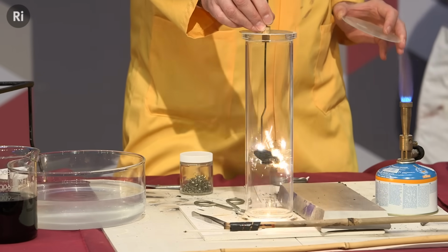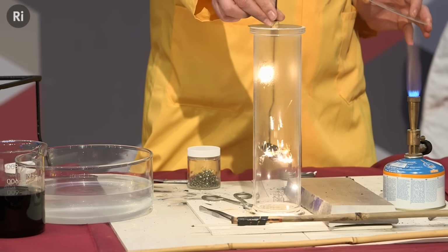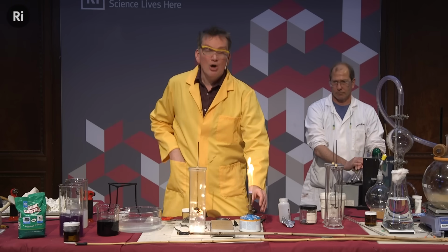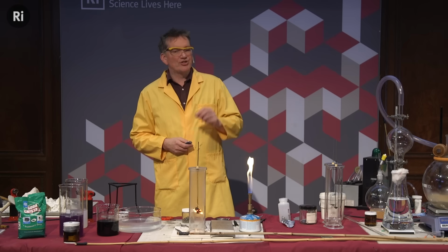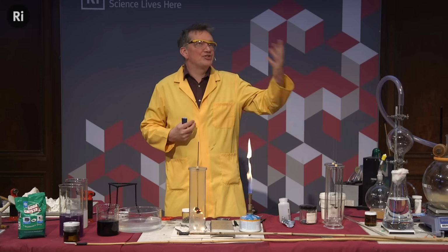we get a much more vigorous reaction taking place here. Okay, so it goes very easily. This is combining with plenty of oxygen. We're going to form carbon dioxide. So 1 carbon with 2 oxygens. Or, as Mendeleev was looking, so he said how many oxygens combine with 2 of the atom.